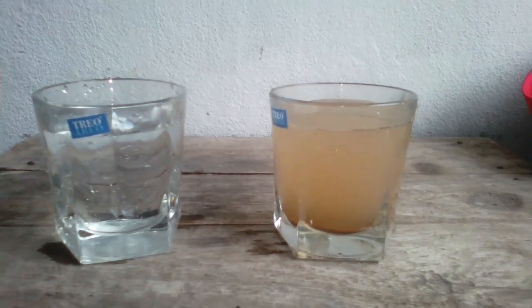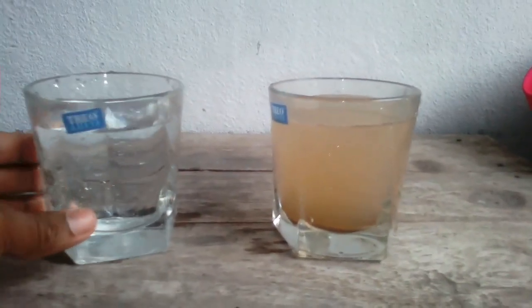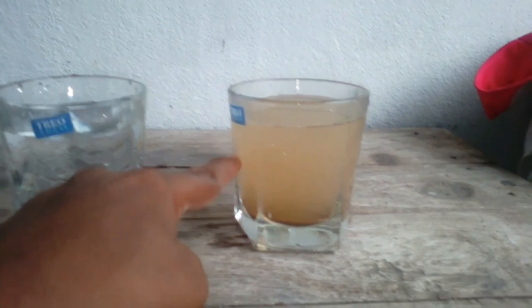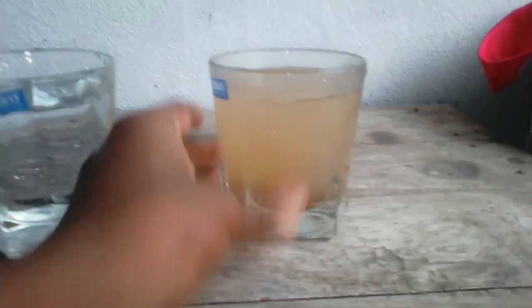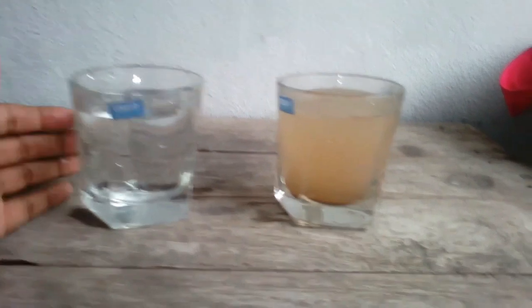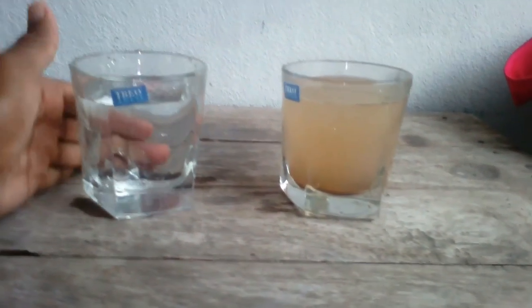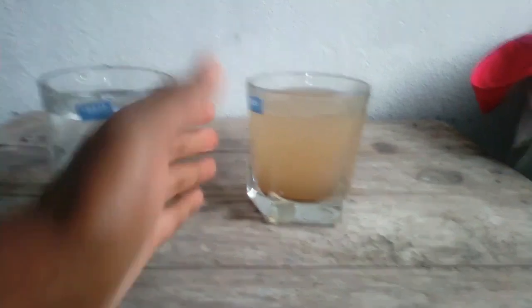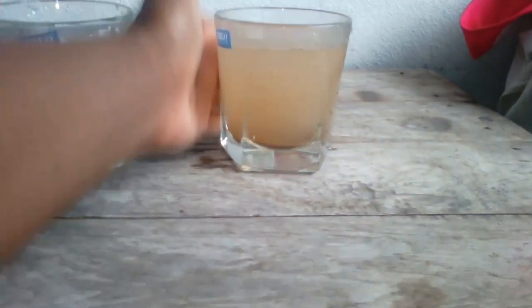Hi guys, now I'll show you how the coagulation process works using alum, practically. I have taken this raw water sample — you can see the mud particles present in it. This is clear water; you can see my fingers are visible through it. And this is the unclear water.